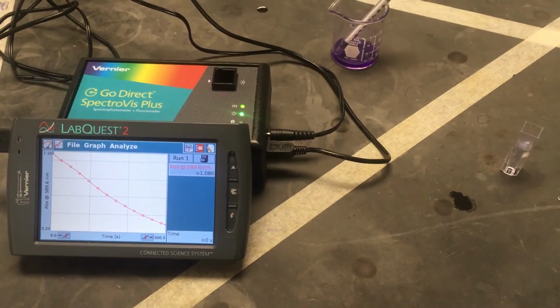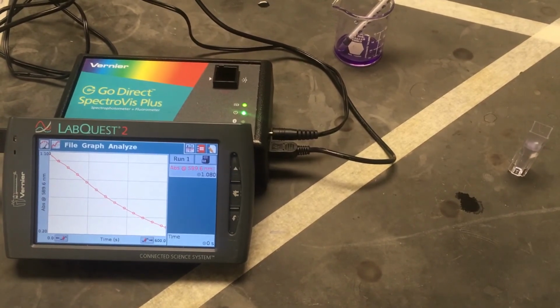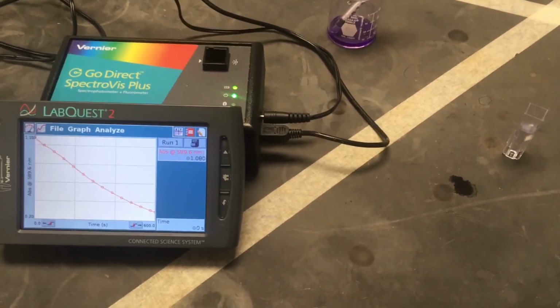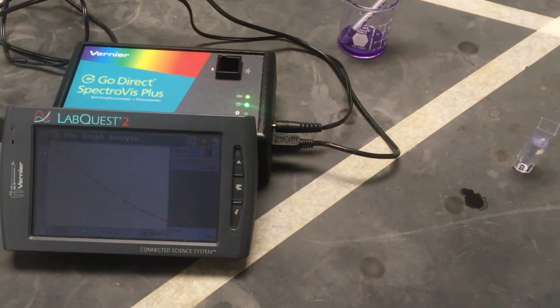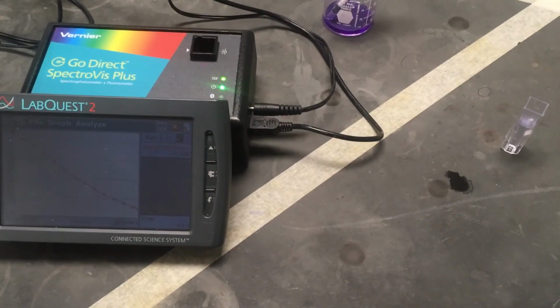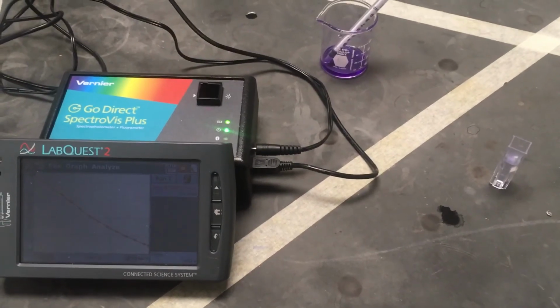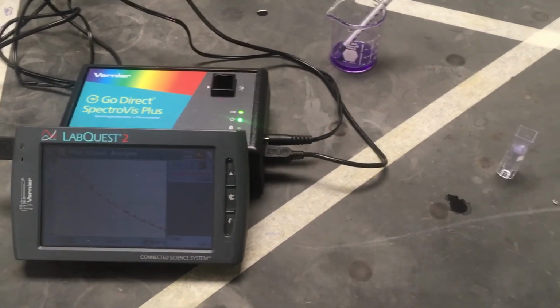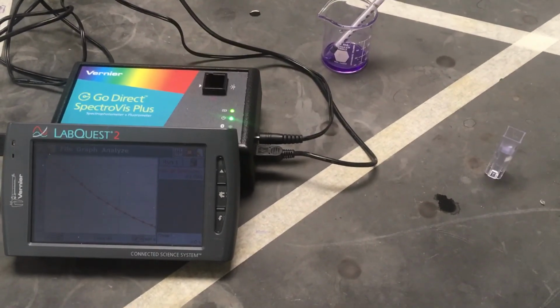And we see there a quick plot. Actually, it looks a lot better when I put it in Excel in terms of whether it's a straight line or a curve. It actually should be a slight curve. If I chop off about the first 20 seconds of data, where I was jostling and putting the cuvette in correctly, then the data looks pretty good. It has a nice general curve, and you'll see that in the Excel file that I send out in a little bit as well. But I just wanted to demonstrate that after our 10 minutes, when our reaction's done, we do see a pretty stark color change, which is what we expect in this case.